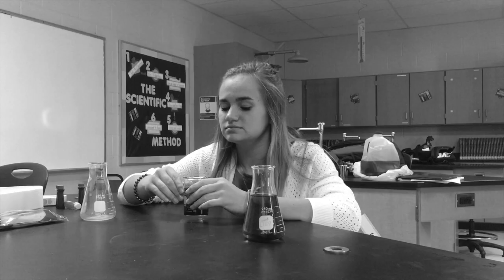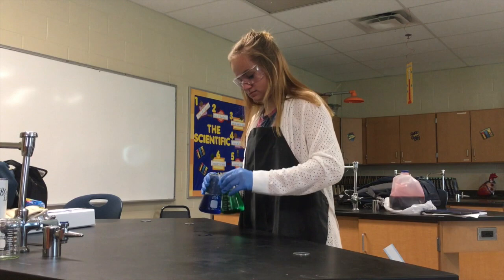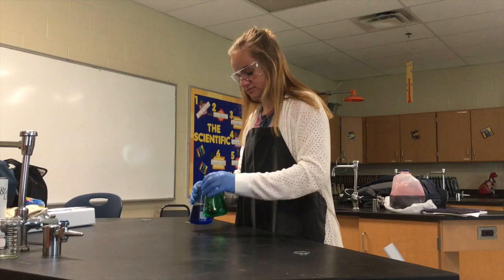Don't you hate when you accidentally mistake acid for moisturizer? Well, worry no more. By keeping your hands out of chemicals and wearing protective gloves, melting your face off is a thing of the past.